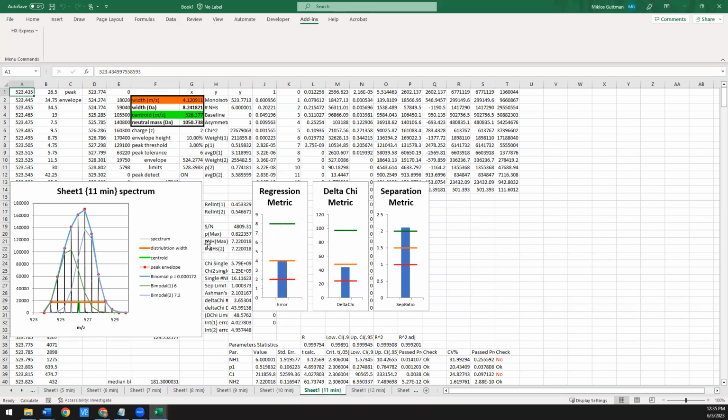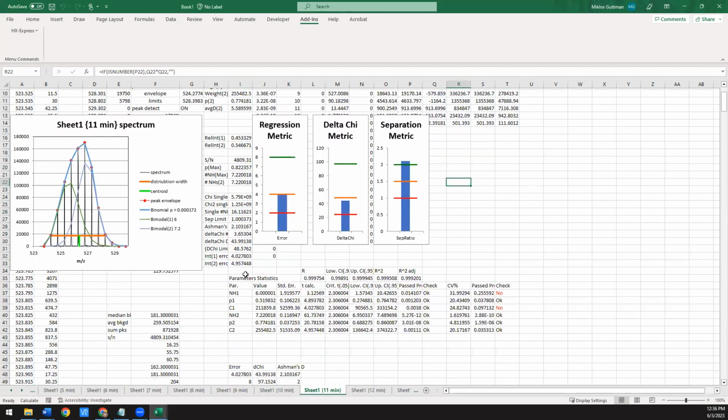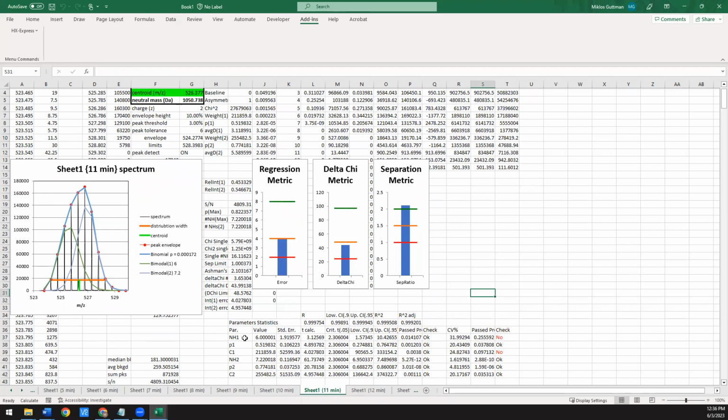So here's what it looks like. Again, you see the two fits. It still pops up the same values here. You see there's now 3 additional graphs that popped up. I'll explain those in a second. And now there's also all this information down here. These are basically all the statistical results from how it was able to do this nonlinear regression fitting. So from this data at the bottom, for each of the parameters that fit, it was able to get a best value and a standard error of the fit.